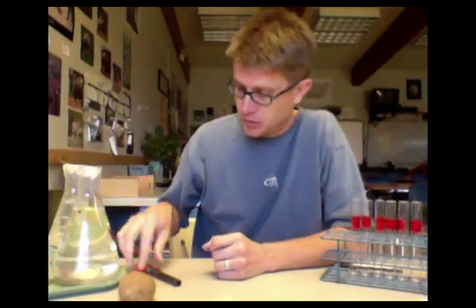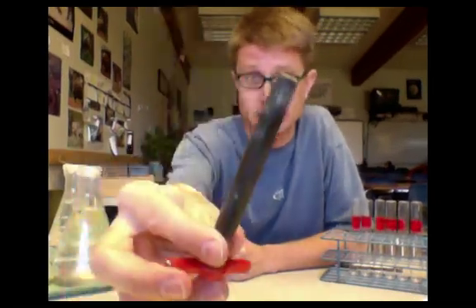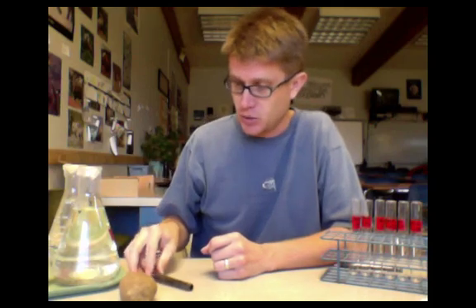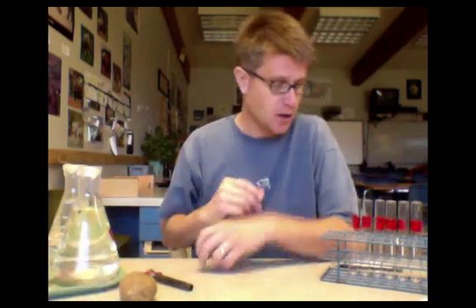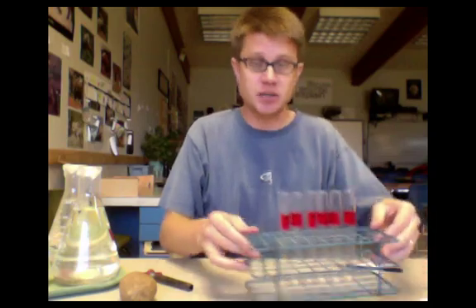What you need is a potato, a potato coring device so we can get a similar amount of potato in each one. I use a razor blade to do much of the trimming. I also need six different test tubes.